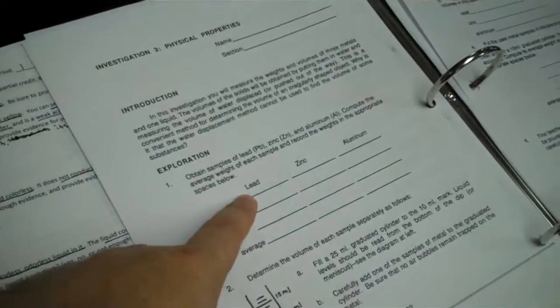So what we've got is 3 little beakers that David has the weights for. One of them's numbered number 1, one's number 2, one's number 3. Okay? So the first sample we're going to do is lead, because it's the first one in the list. So grab beaker number 1 and stick it up on the scale. Thank you. Okay, now grab the lead. Yep, that's the lead.